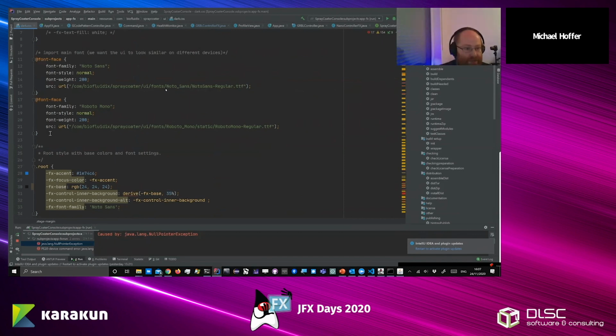So here we just import a couple of fonts, because for us it's important that the application looks similar on all platforms, and that's why also the number keypad was important, because we didn't want to rely on the Windows keyboard or something like that. And if we ever need letters, I know Dirk has created a keyboard that looks nice.